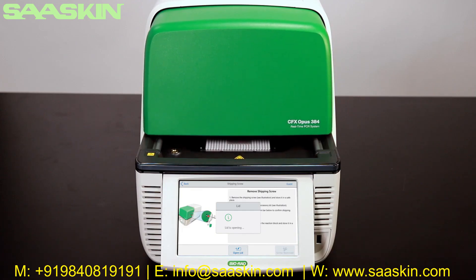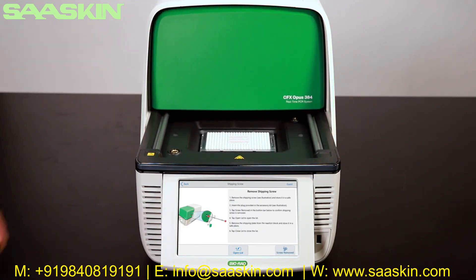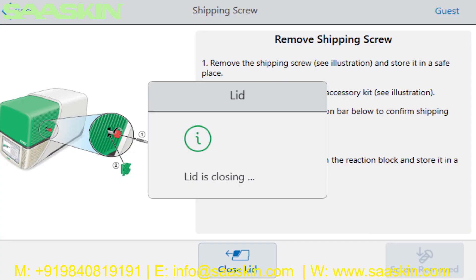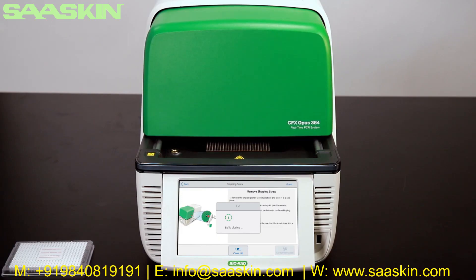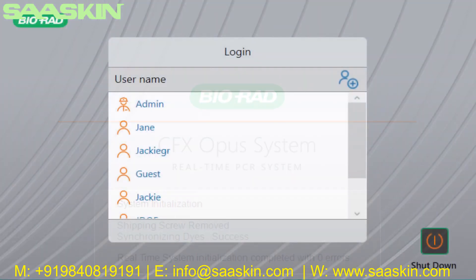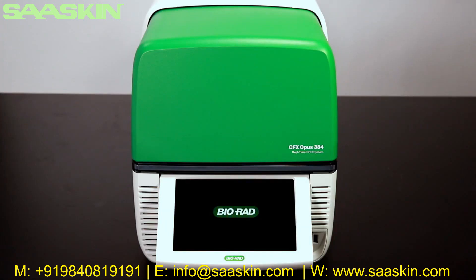The system will run a self-test and then display a confirmation screen. Press OK, then press 'Open Lid' and wait for the lid to fully retract. Remove the shipping plate and store it in a safe location. Press 'Close Lid' and wait for the lid to close. The instrument will automatically enter a self-testing sequence, and when complete the login screen will display. You can create new user profiles or log into existing ones — your instrument is now ready to use with no additional calibration necessary.